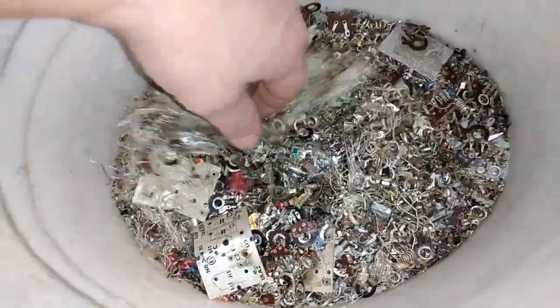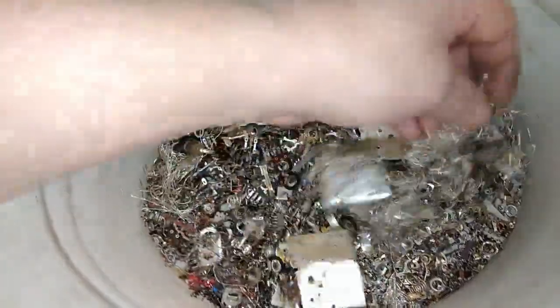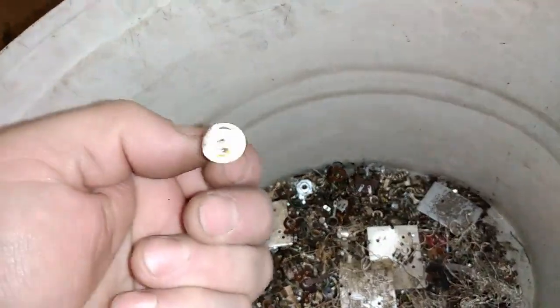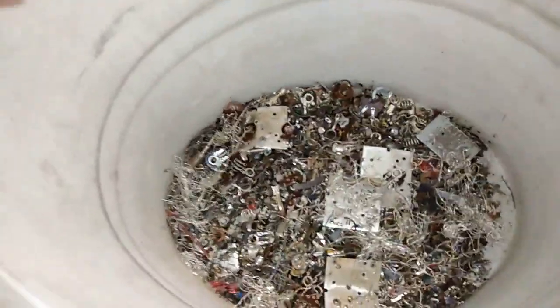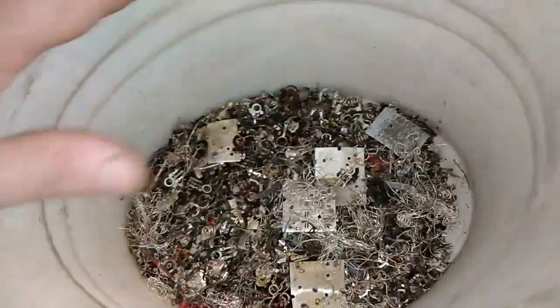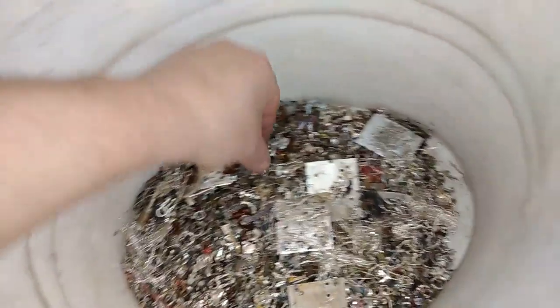I got a lot of stuff there and everything is mixed. So, the process which I use here is a melange. Melange is the step when you cover all that with the sulfuric acid.